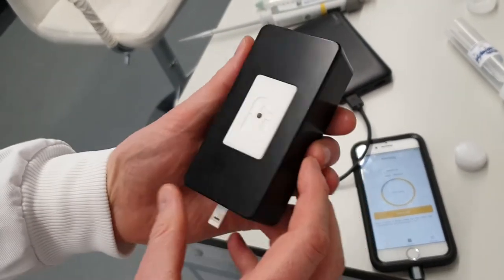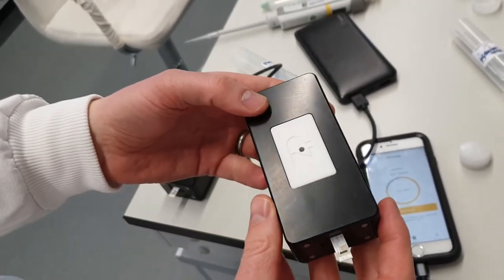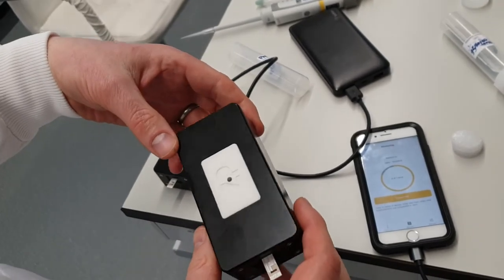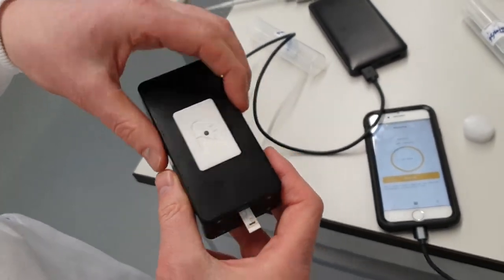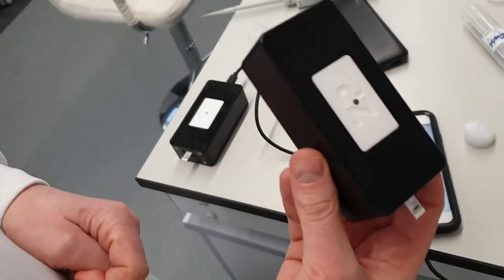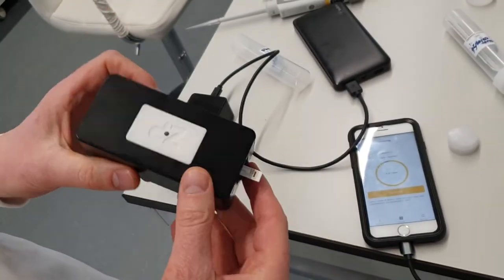They're very robust, and it's a good fast test for things like what's the hotness of my chili, or what's the pungency of my garlic. And they all work with exactly the same meter. It's only the sensor that changes. So we're just getting to the end now.